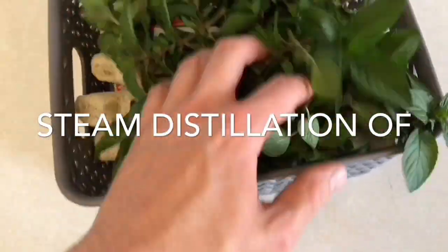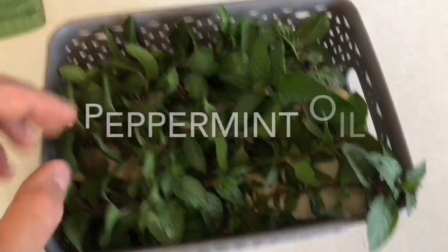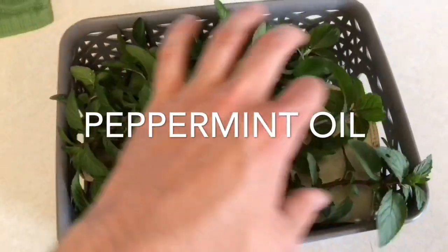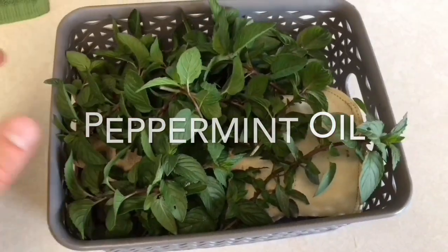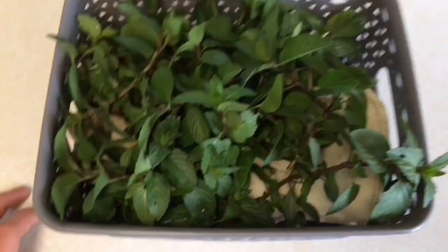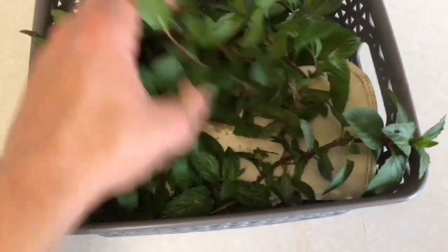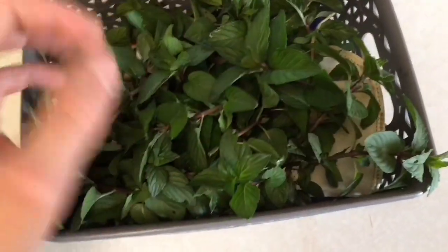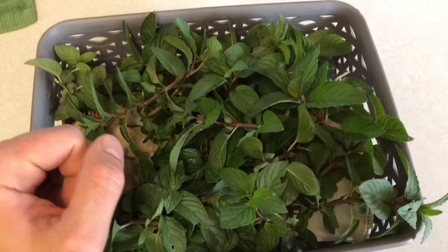I've come back from the garden. My peppermint plant is doing awesome, and I decided I was going to cut off some leaves and try to distill some oil. I wanted to record the process. I only have a few distillations, but I've never done anything with a leaf or a leafy fragrance.